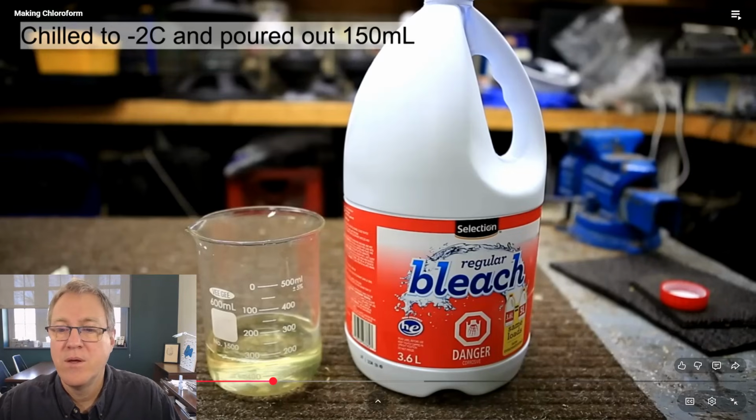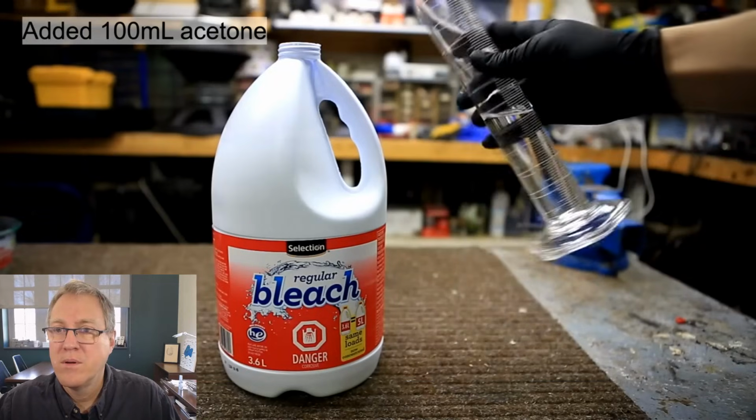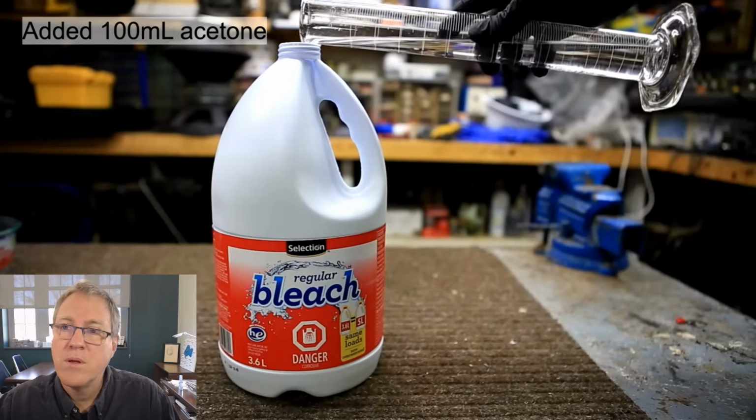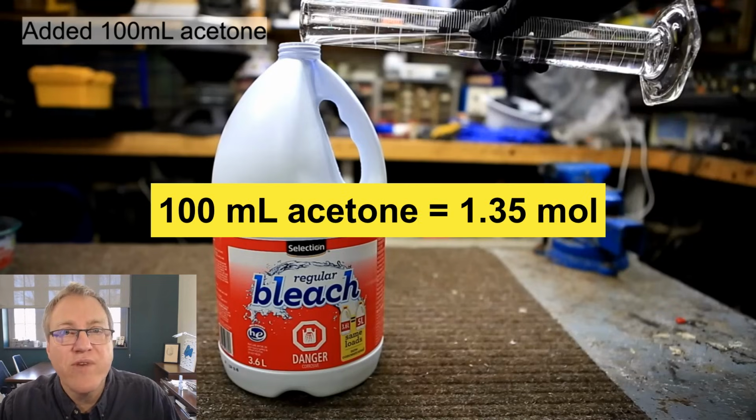For the addition, I added about 100 milliliters of acetone to the bleach, which represents an excess of bleach at around 11%, I think. Now, if you go through the math, 100 milliliters of acetone is about 1.35 moles of acetone. And so that is his limiting reagent for this reaction.